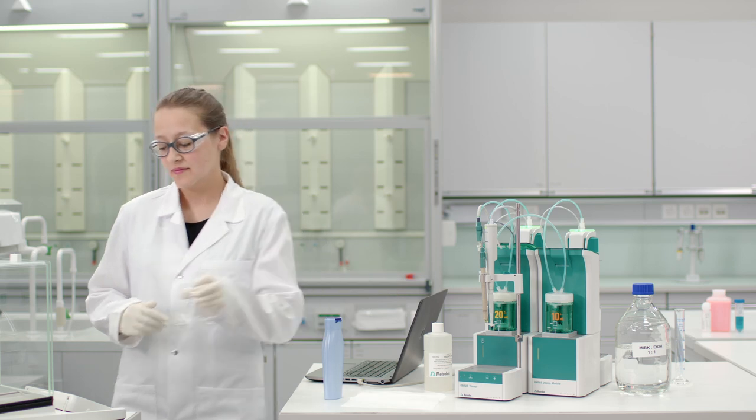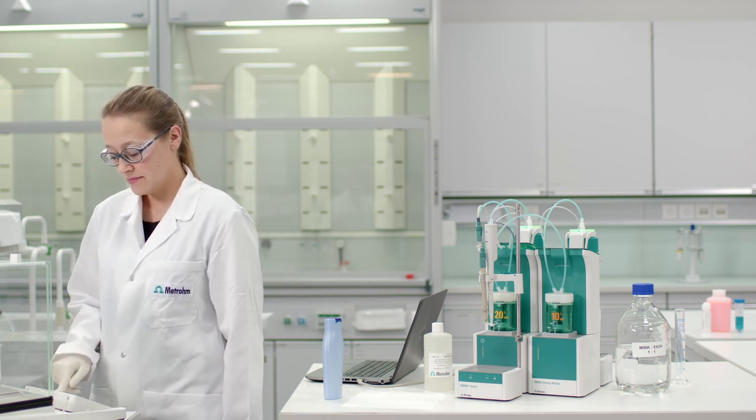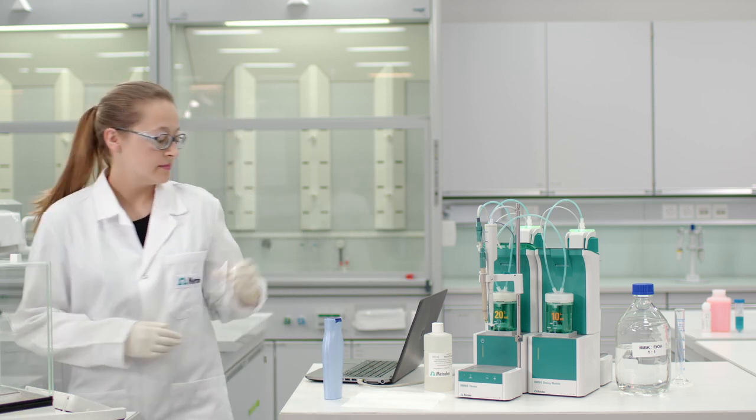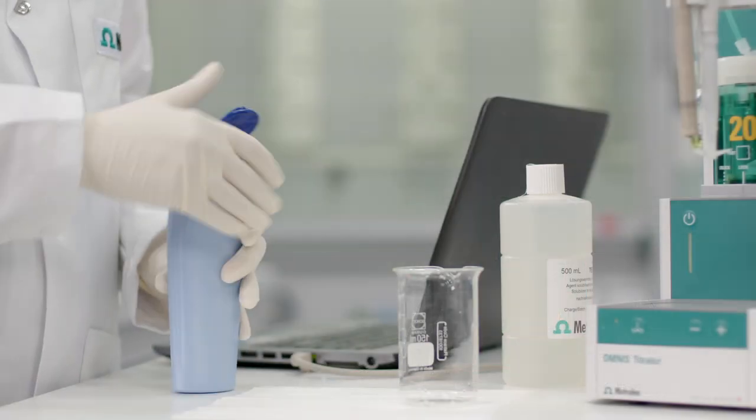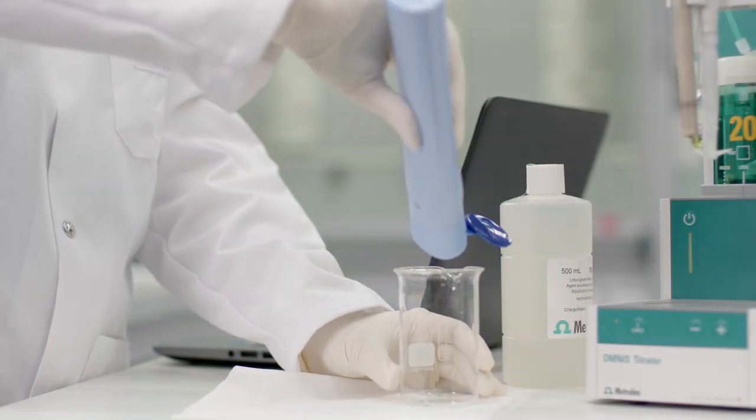Now I will show you how the anionic surfactant content of shampoo is determined. Weigh the sample. The amount depends on the expected surfactant content of your specific sample.